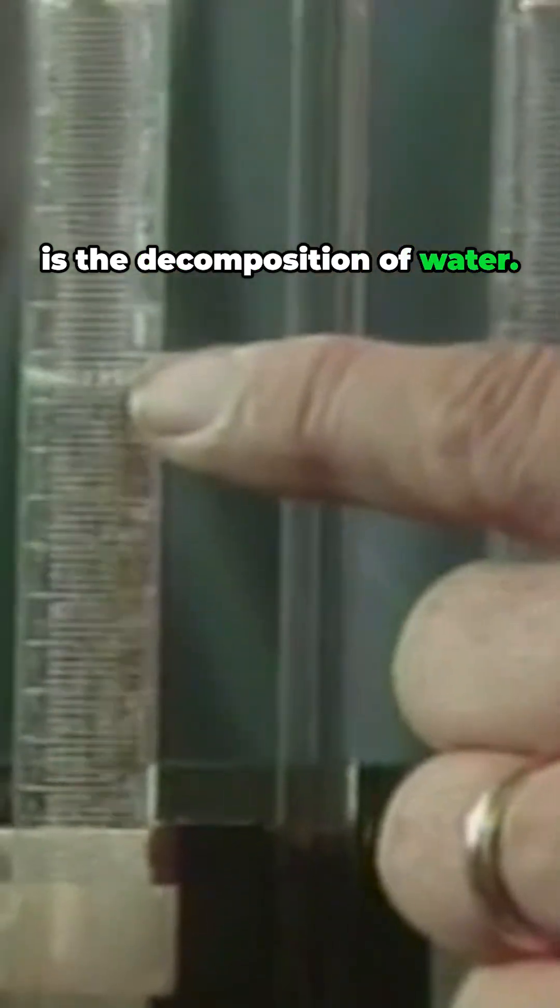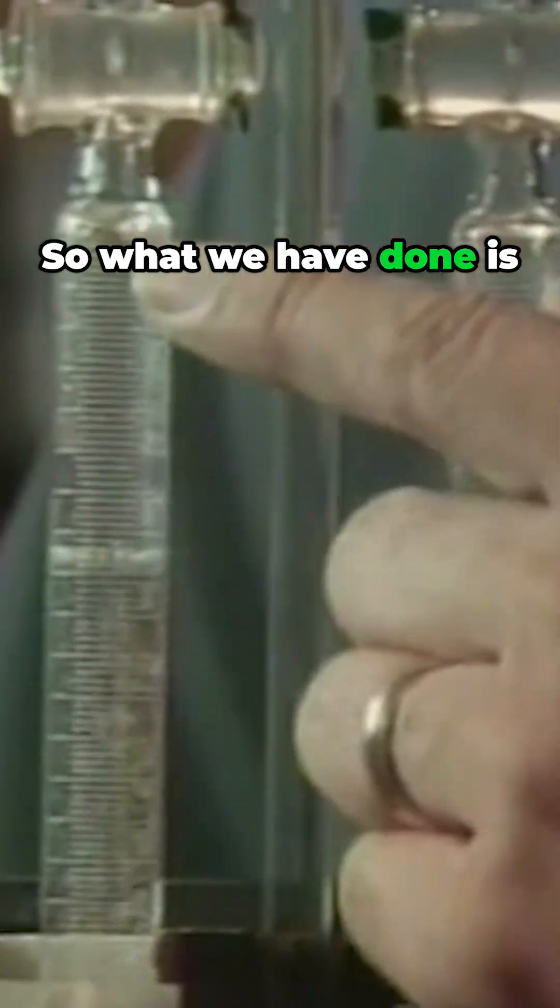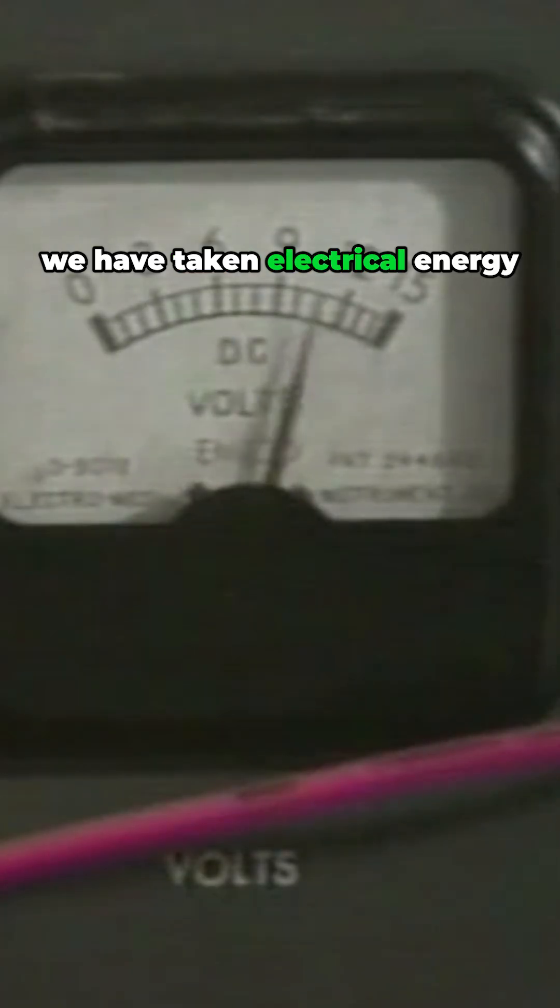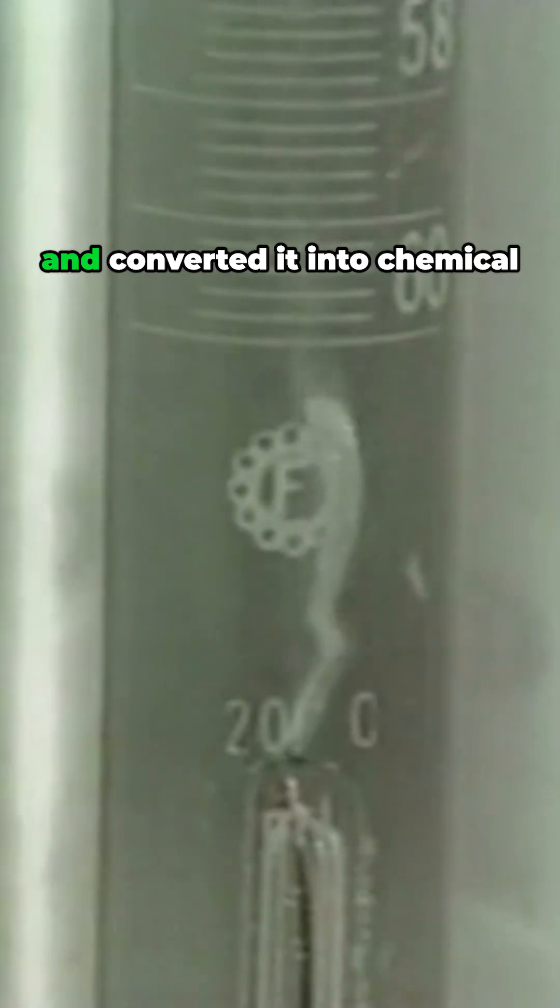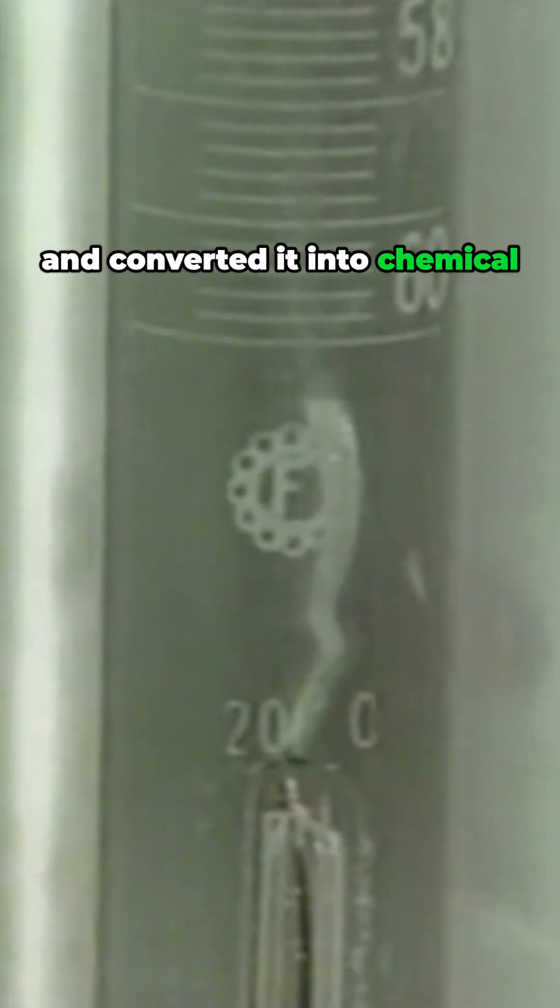So what we're seeing now is the decomposition of water. So what we have done is we have taken electrical energy and converted it into chemical energy, electrolysis.